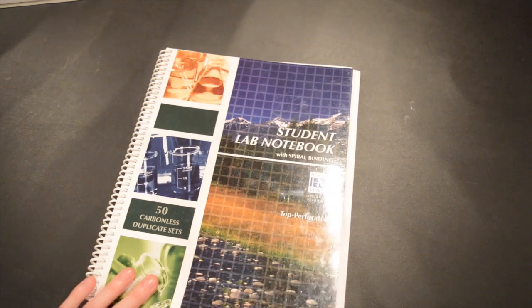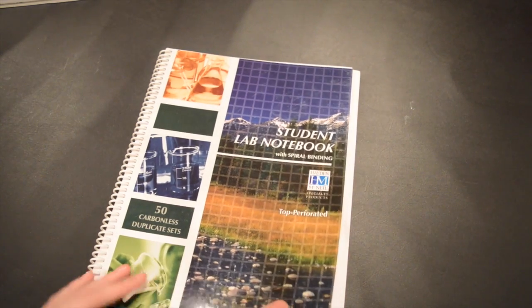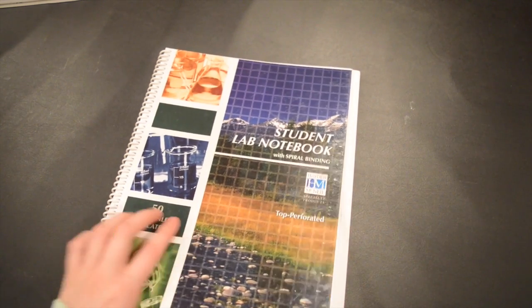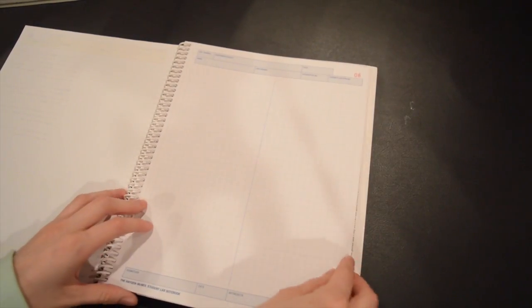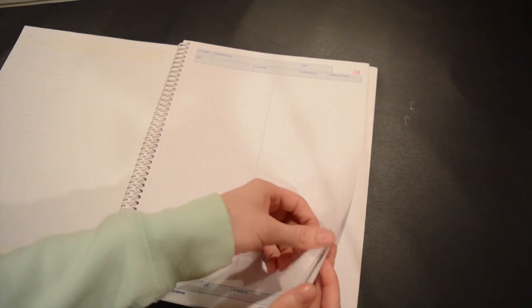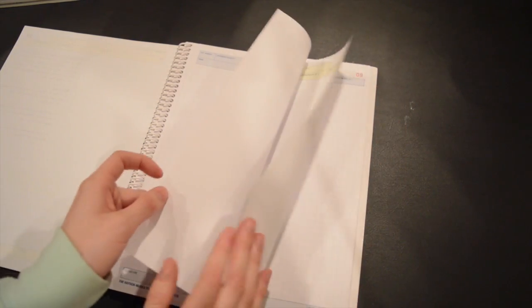Today I'm going to be demonstrating how to use a student lab notebook to write a chemistry lab report. Your first step is to open to a clean page in your notebook. You'll notice that the pages are numbered in the top right hand corner, and for each number there are two pages that correspond with that number.